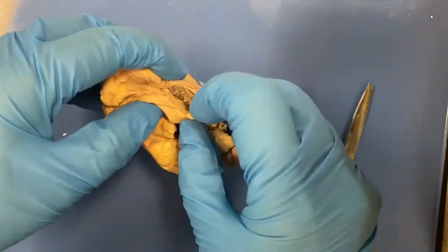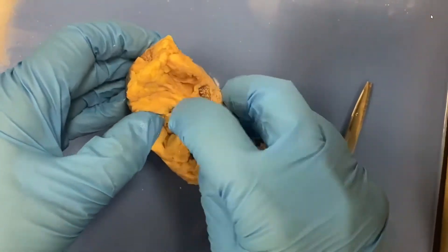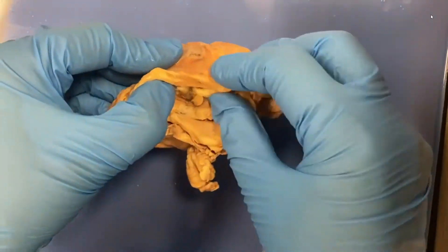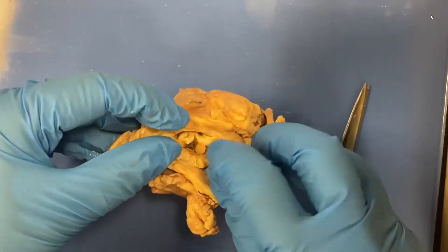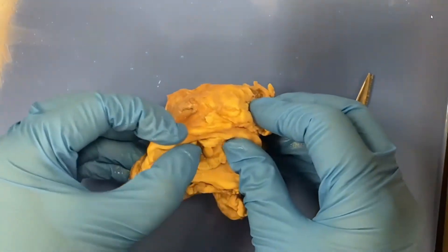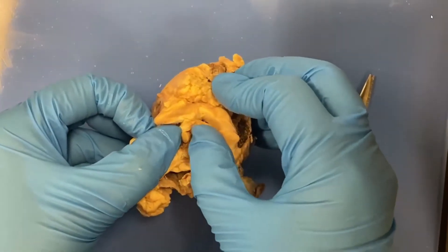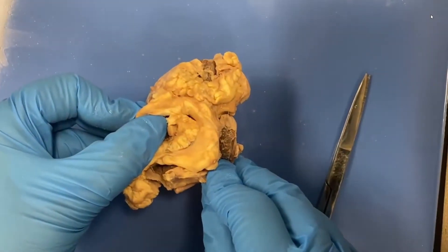I may not be able to find it real easy. Oh, there it is. So I've gone through all this fat, and you can see the structure trying to peek out right here — that's going to be our optic nerve. Can you remember what cranial nerve that is? You have two eyes to see with, so that should help you know which cranial nerve the optic nerve is.